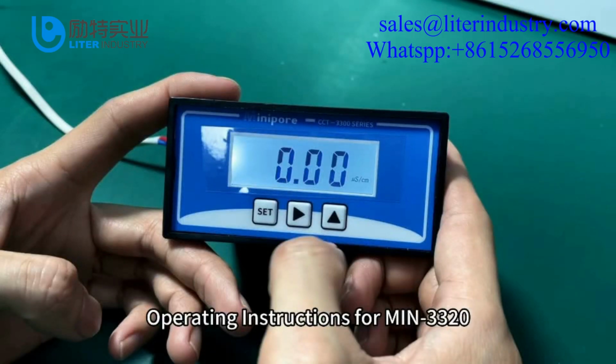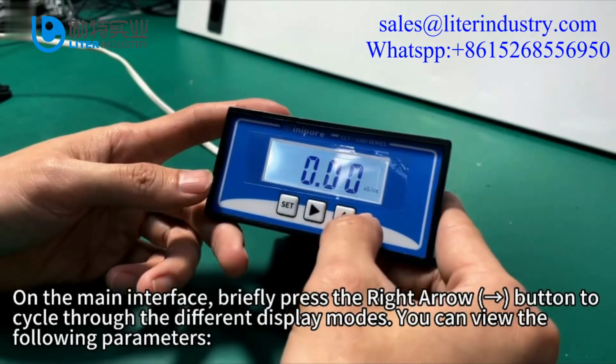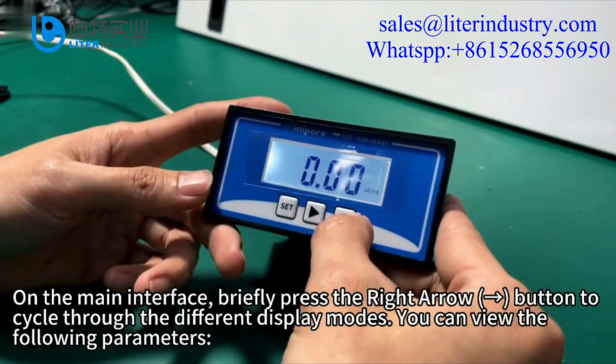Operating instructions for MIN 3320. Cycling through display modes. On the main interface, briefly press the right arrow button to cycle through the different display modes. You can view the following parameters.